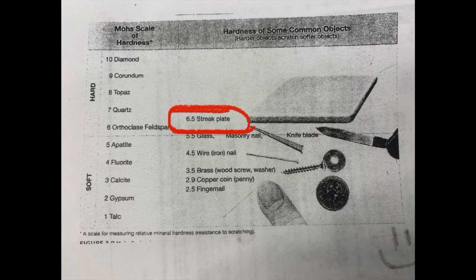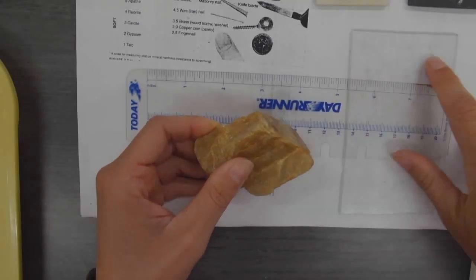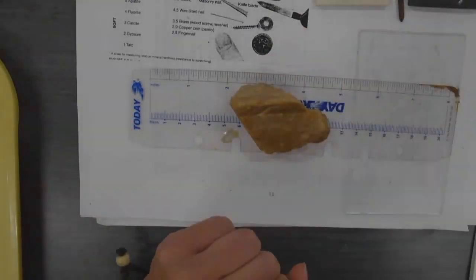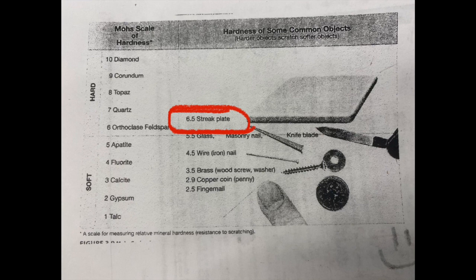So this property is hardness, how hard a mineral is. We're going to use our good old friend, the Mohs hardness scale, to determine that. The Mohs hardness scale is a 1 through 10 scale of relative hardness, and it's based off if minerals scratch or are scratched by other things. You may see me scratching something with either my fingernail or like an iron nail, and that's to see if it is harder than that or softer than that. If it is scratched by it, it's softer than that. If it scratches the thing, then it is harder than that.